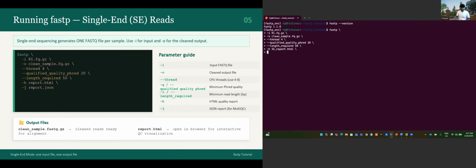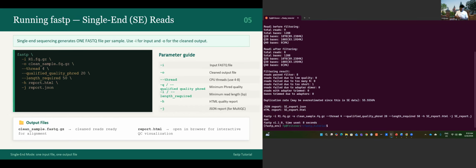And if you also want a JSON report, just dash j single_end_report.json. I think I mistyped JSON. And that's supposed to work. Let's try. If not, we will troubleshoot to see if I mistyped something. Okay, now it's working. It's detecting adapter sequence, read1, no adapter. Now I think it should be okay. It worked. It takes about 8 seconds.